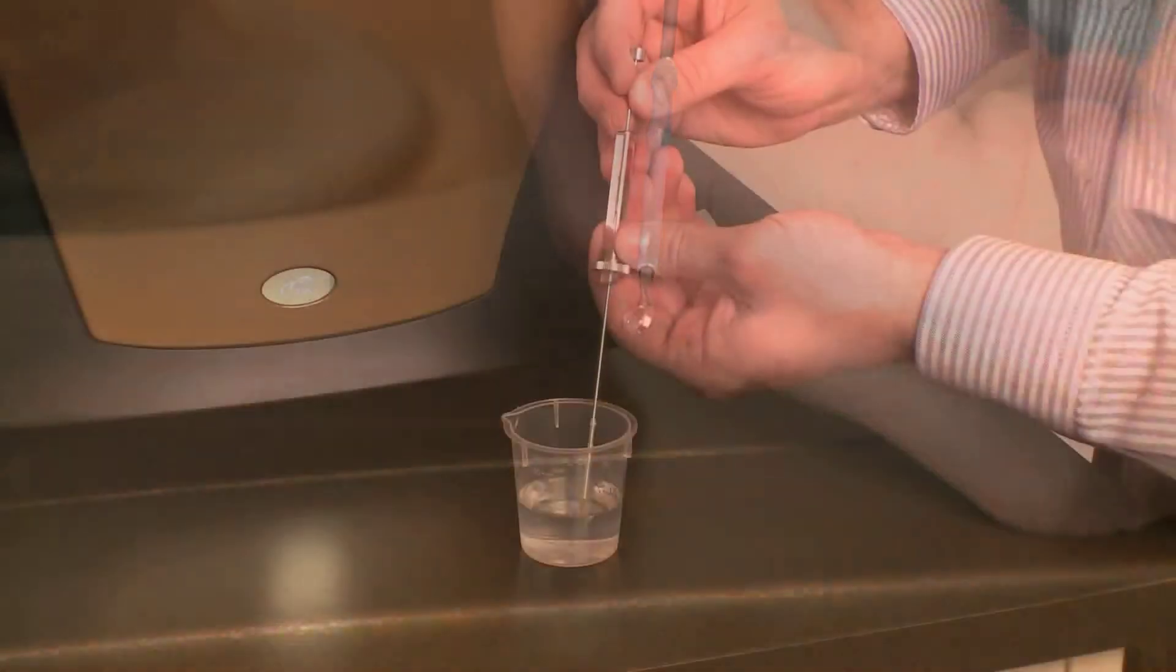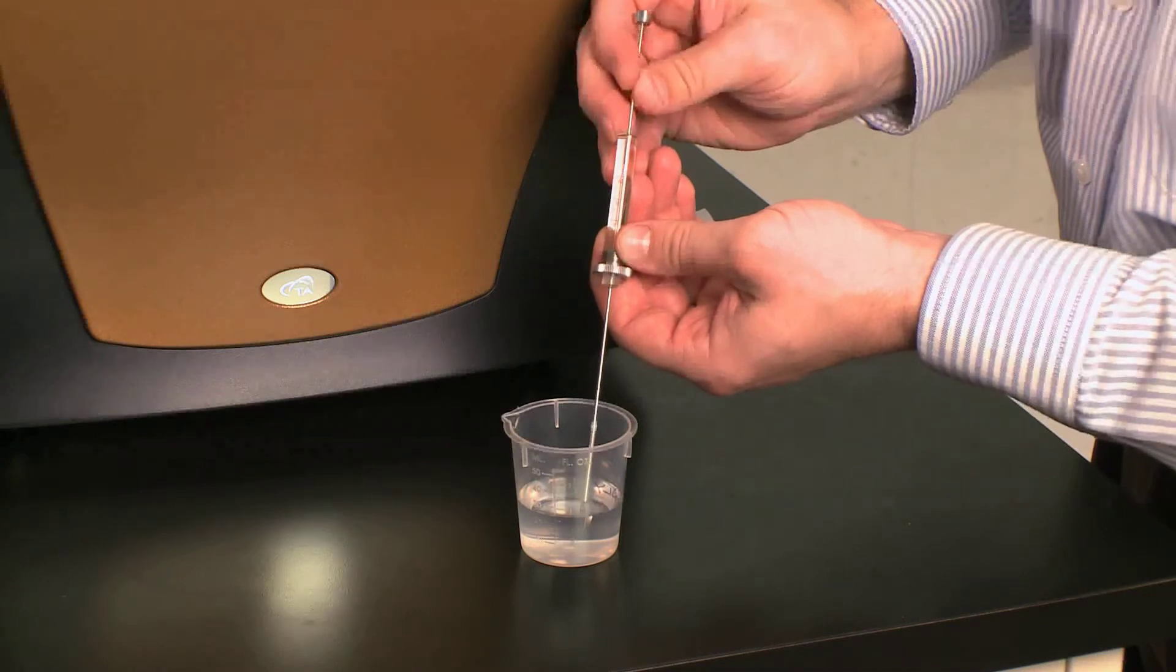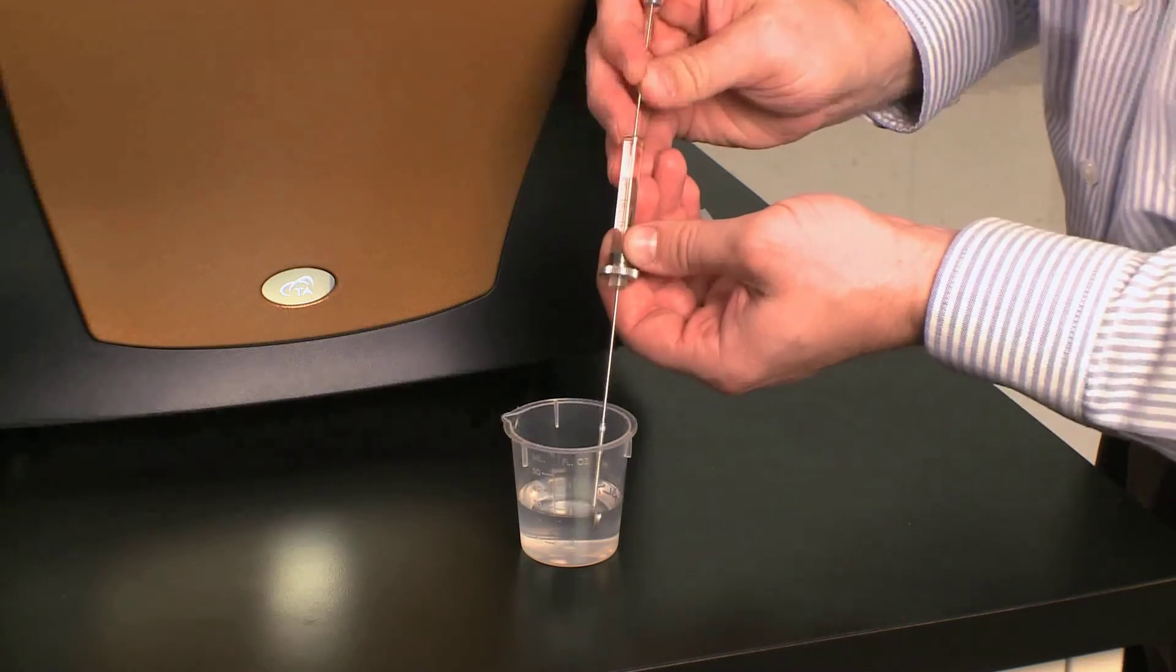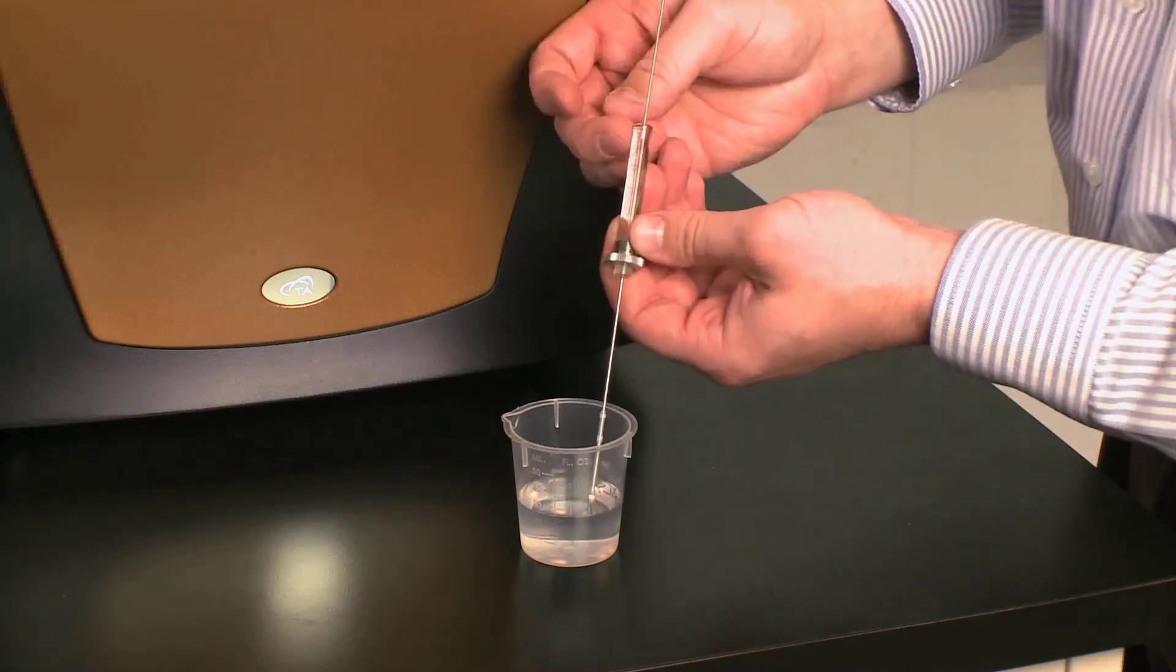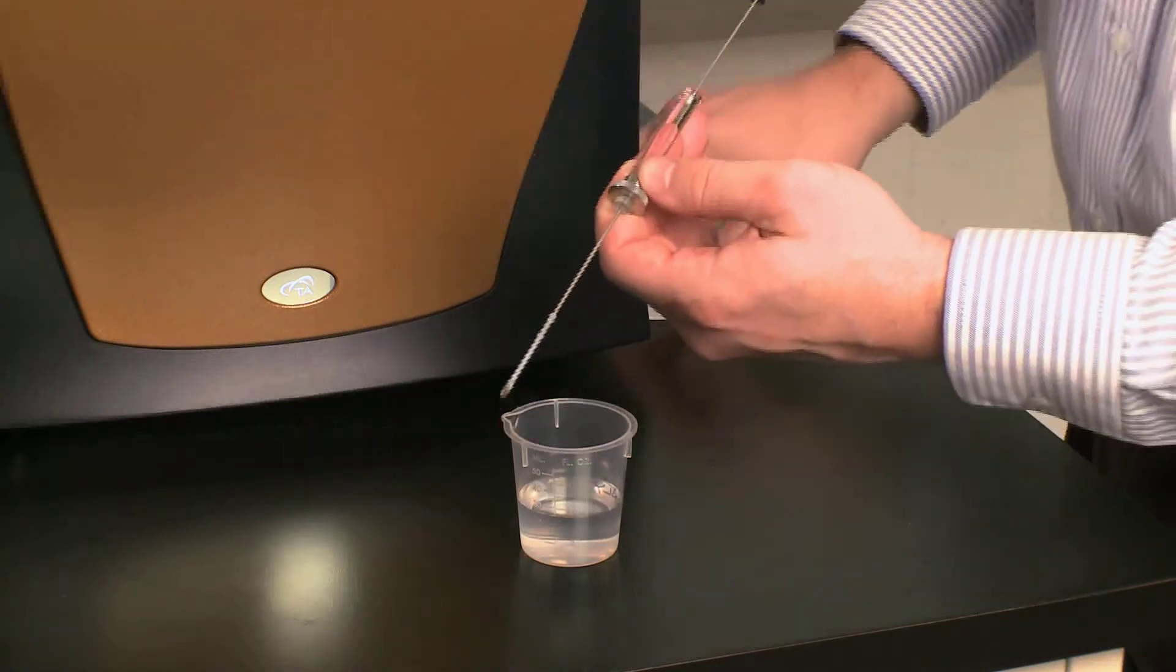And then I can take up the water nice and slow with no bubbles until I'm past the last graduation on the syringe. And now the syringe is full.